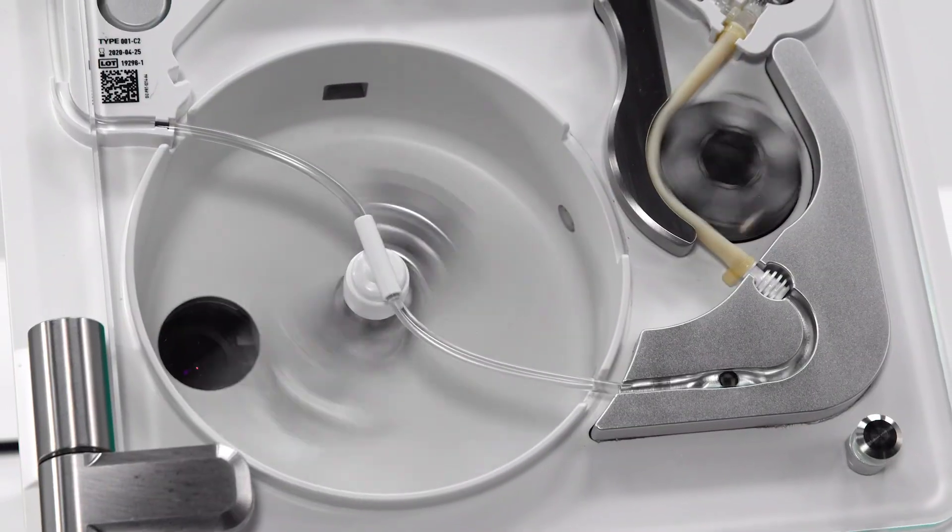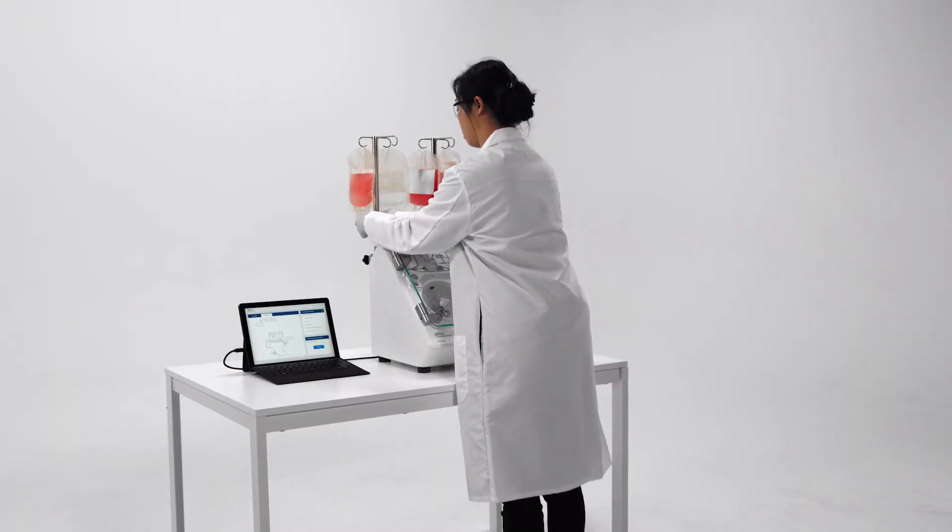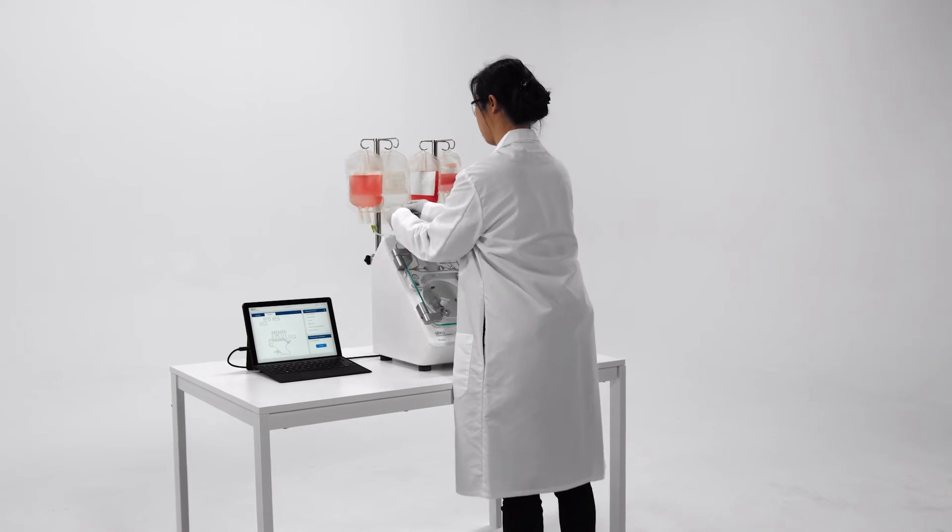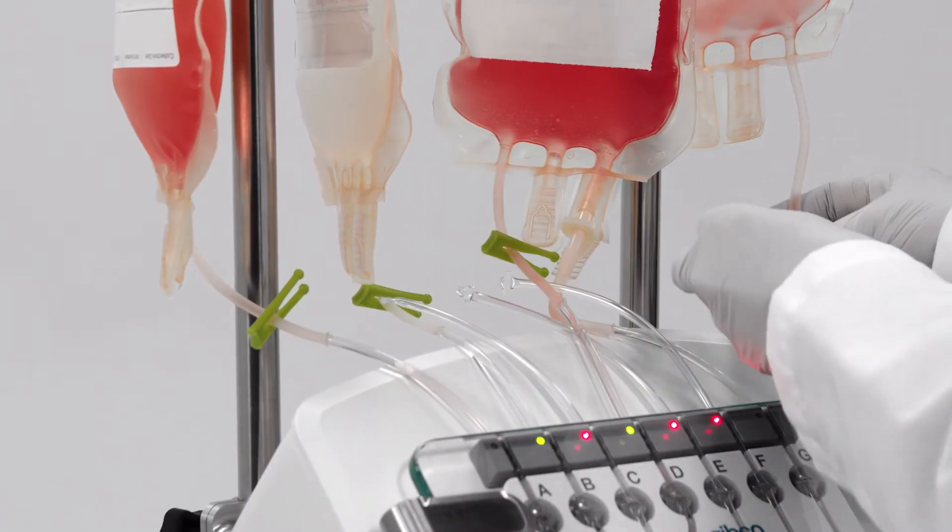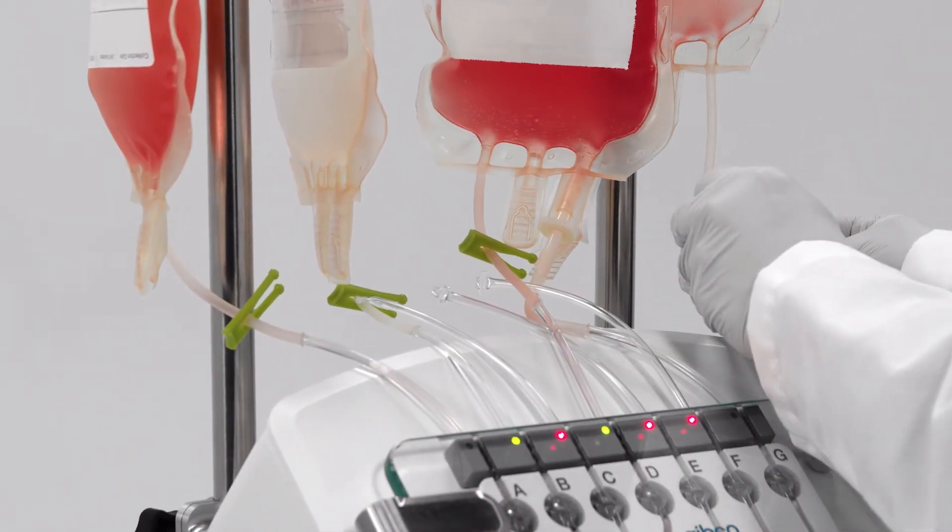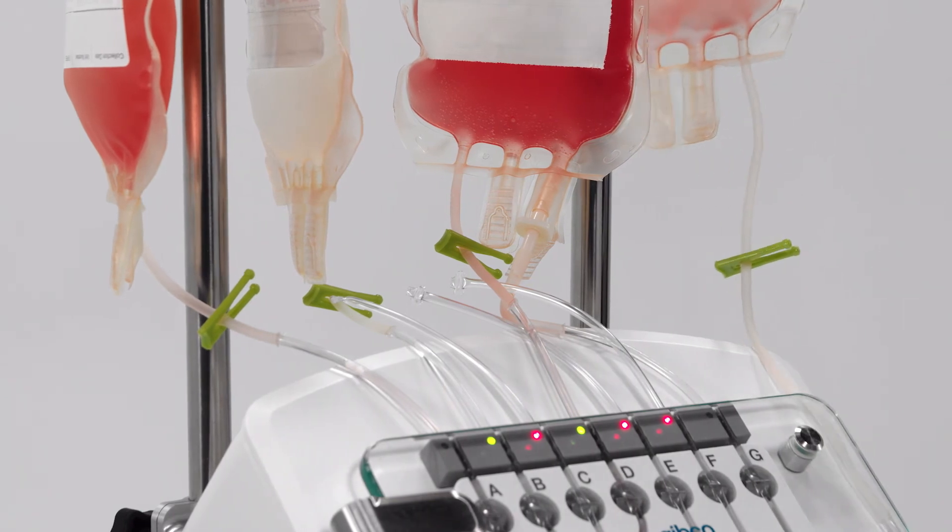Fifth, after the protocol is complete, take the single-use kit with concentrate off the instrument. Aseptically seal the tubing and remove the desired output bag. Ensure manual clamps are closed to secure the fluid in each kit bag.